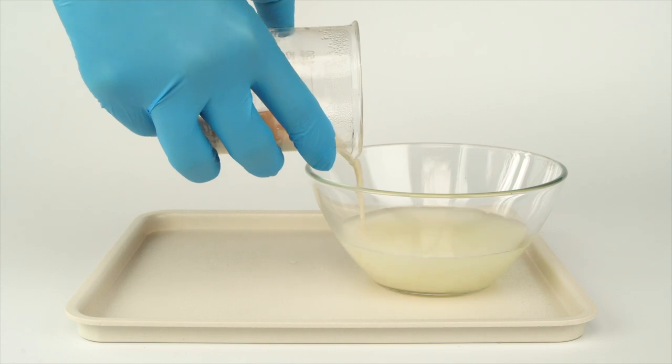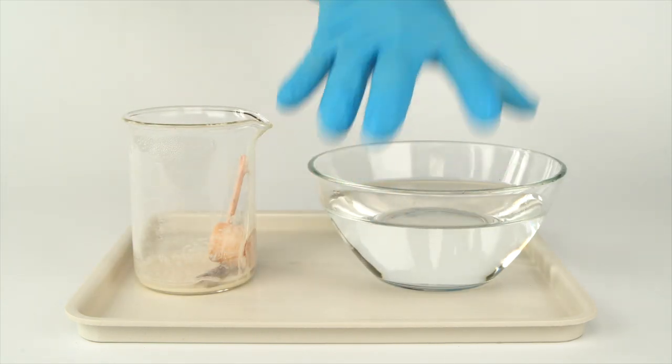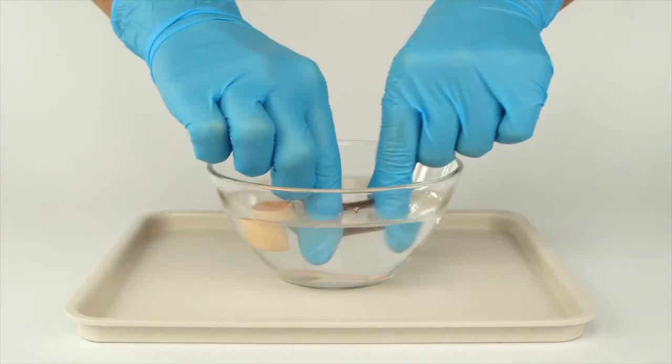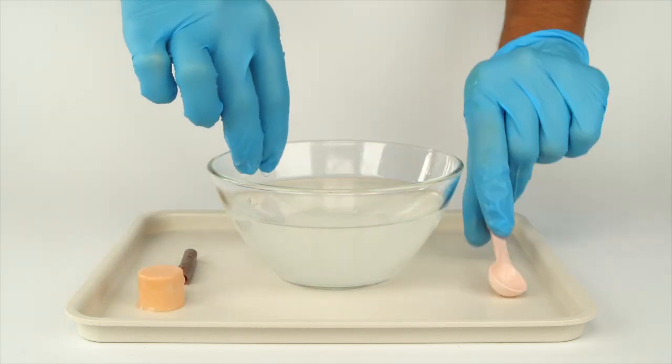Carefully pour out the liquid. Rinse the plastic items off thoroughly with water and place them on the tray. Do not leave the stained items on unprotected surfaces.